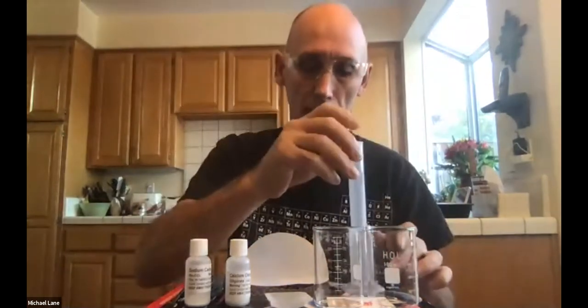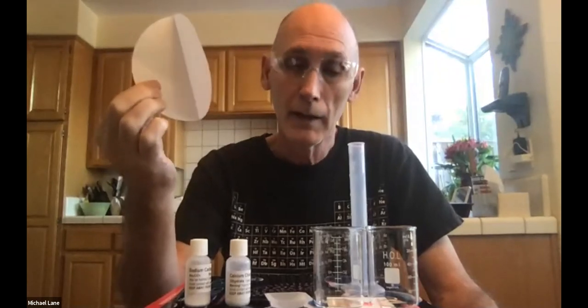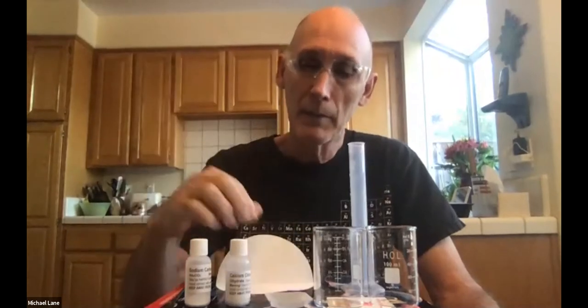The 25 milliliter graduated cylinder and one piece of filter paper. I find it curious that of all of the things HOL tried to save money on, it was by not giving you 2 pieces of filter paper. So you only have, I think, 1, which means that you don't have an opportunity to do this experiment twice. And maybe that's just as well, because I don't think they've given you enough chemicals to do it twice. But please, don't get this torn, or you simply won't be able to do the experiment.